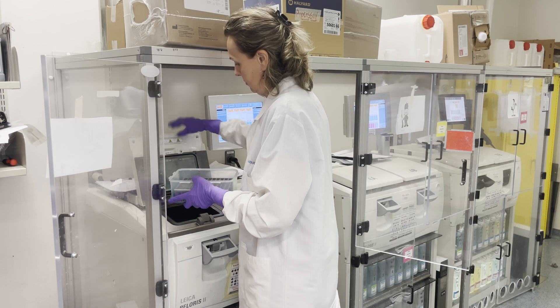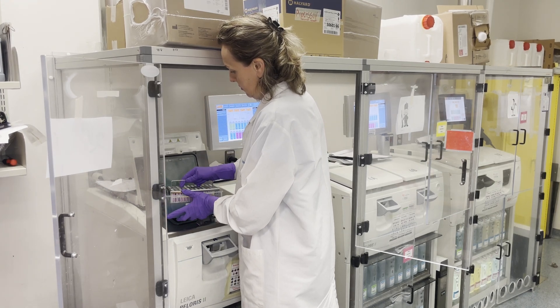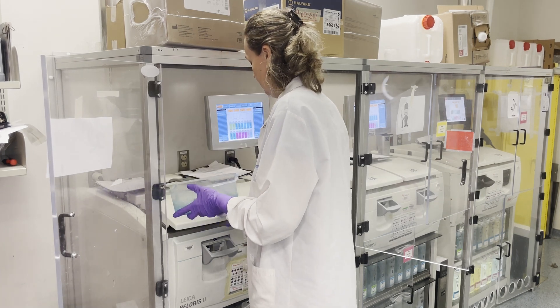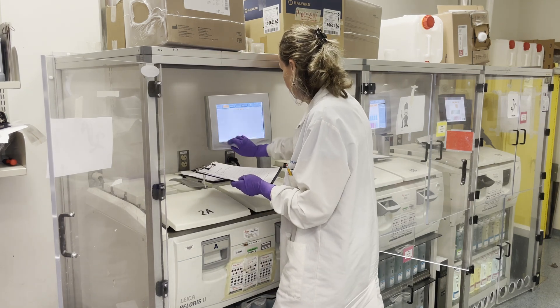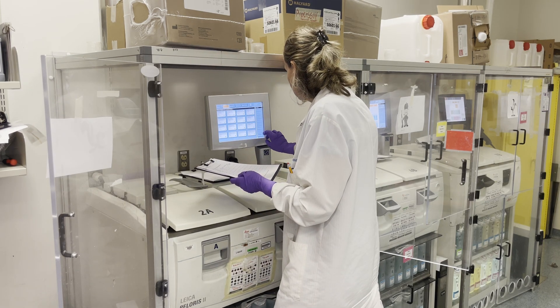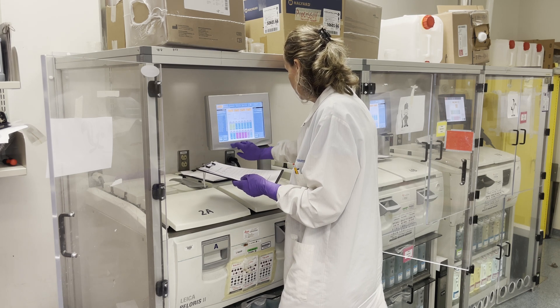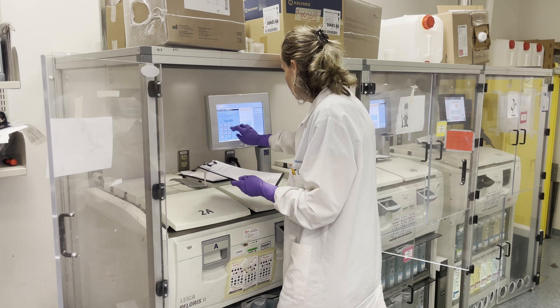After spending several hours in formalin, a liquid that preserves the tissue, the cassettes are removed to the processor. The purpose of the processor is to dehydrate, or remove, the water from the inside of the tissue and replace it with a type of wax called paraffin. This step can take anywhere from 2 hours to 8 hours, depending on the type and size of the tissue sample.